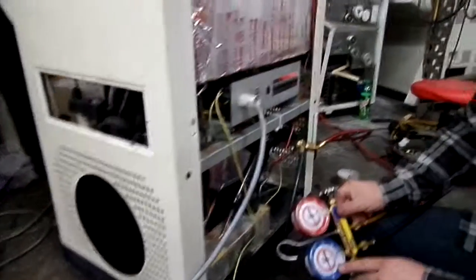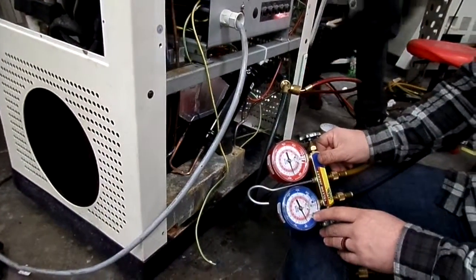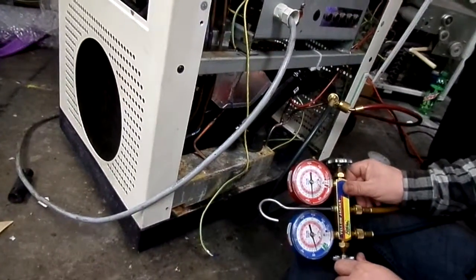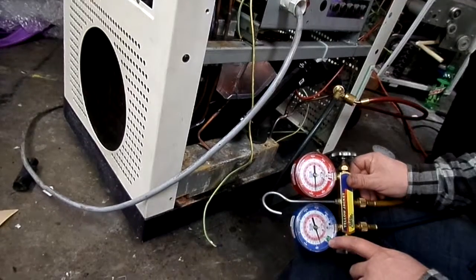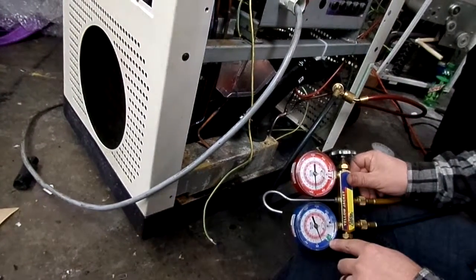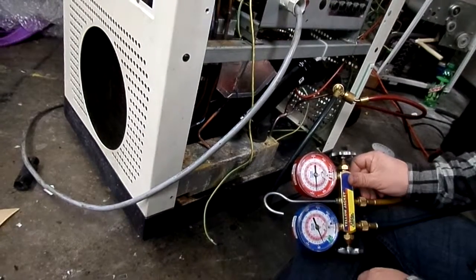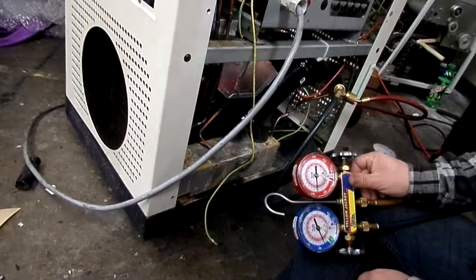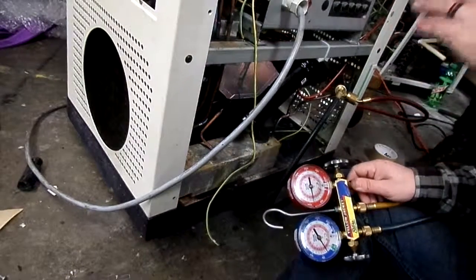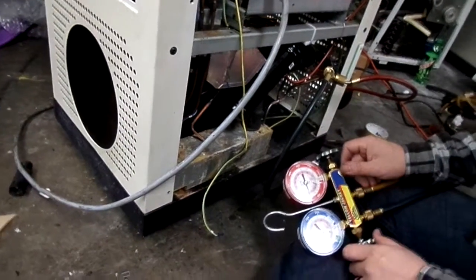Sounds good, and you can see your pressures here. The low side is dropping. High side is increasing. This will continue to drop until probably between 5 and 10 psi. And that's right around where we want it to be. And it won't get there until the machine's been on for a while and it's pulling at the temperatures that it's actually going to be running at.